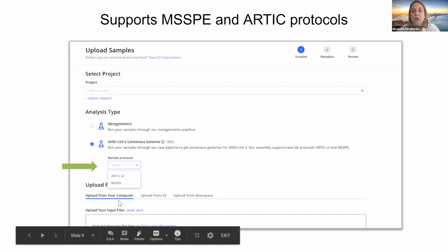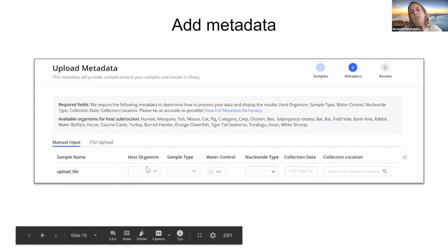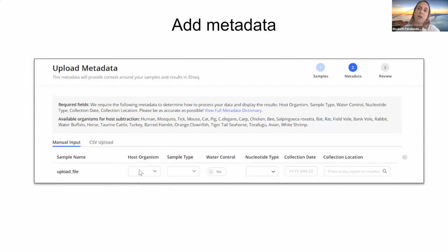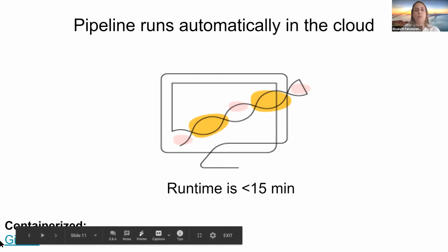Then you can upload from your computer or directly from BaseSpace if you have a BaseSpace account. So from here, you can add the metadata associated with the sample. So you can add human here if it's from a human host. Add your sample type. So if it's nasopharyngeal swabs, you can add that here. And if you have water controls, you can toggle this on to identify them as water controls. You add your nucleotide type, so RNA, collection date, and collection location. And then from here, you upload, and then the pipeline will run automatically in the cloud. It usually takes less than 15 minutes for it to complete. And all the code for the pipeline is available on GitHub.